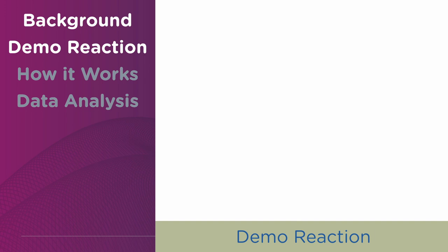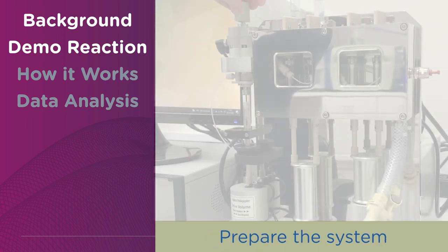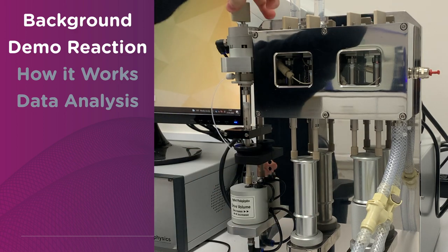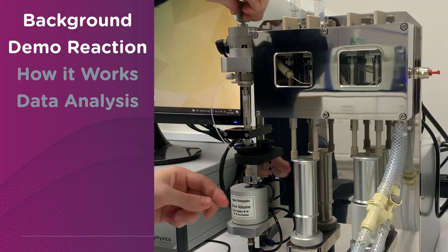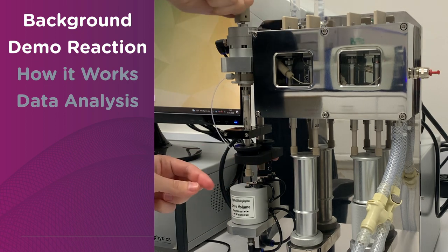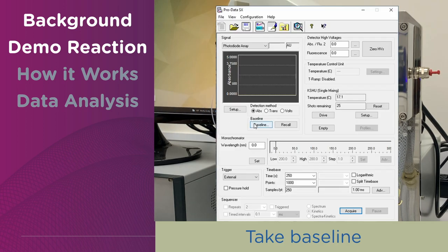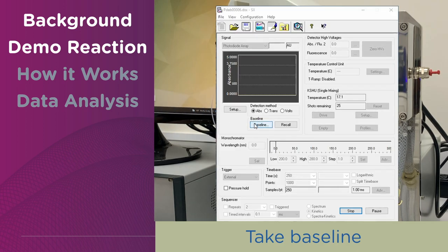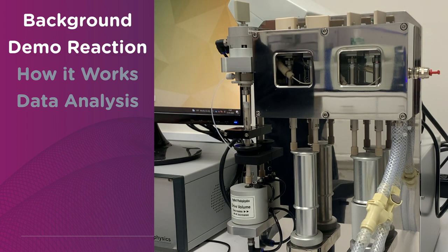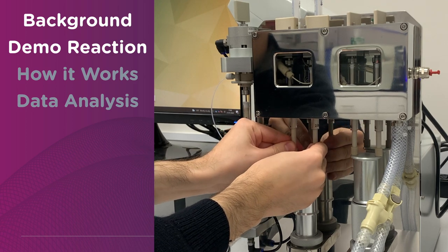To do that, we will follow this protocol. First, we prepare the system by flushing flow lines with water and buffer if required. Then, we take the baseline scan. Then, we load enzyme and substrate into individual drive syringes, and prime the flow lines with solutions by pressing drive three or four times.